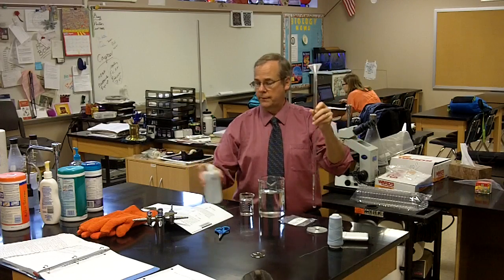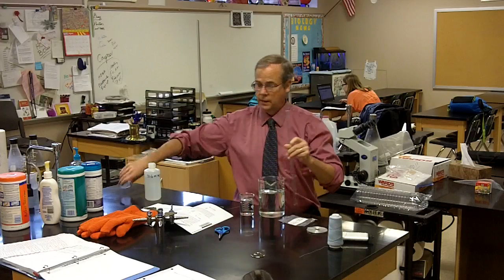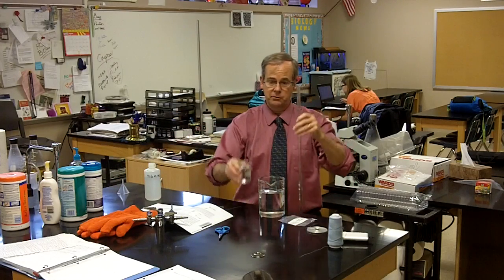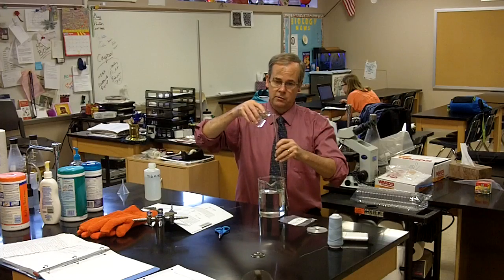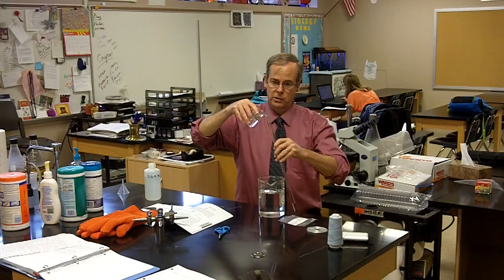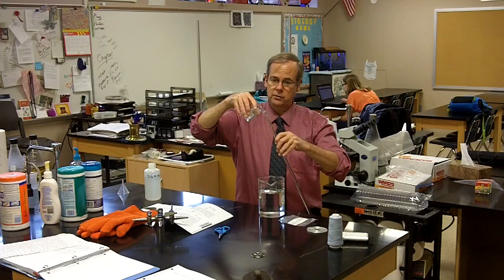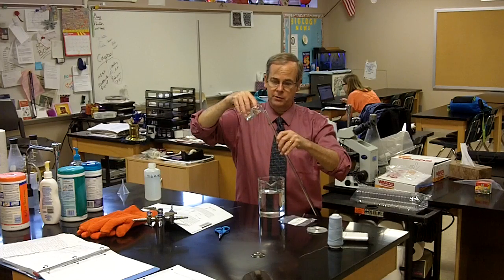Now I'm ready to fill the rest with water because we can't start with any gas in the tube. It must be filled entirely with water. So I will carefully pour water down the side of the tube. Water is less dense than the acid solution so the water should be on top at this point.